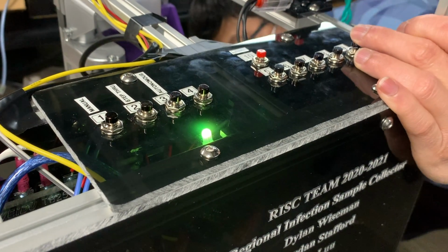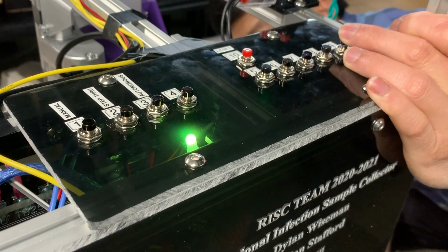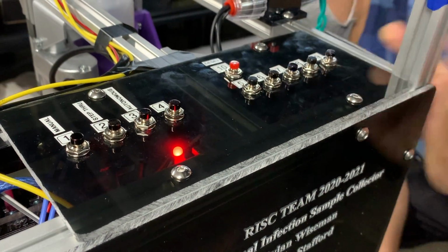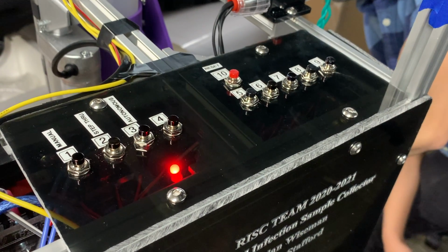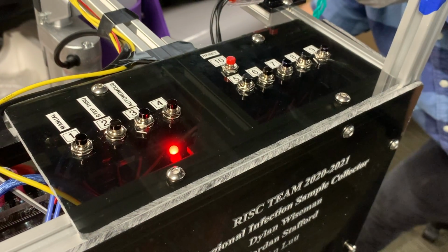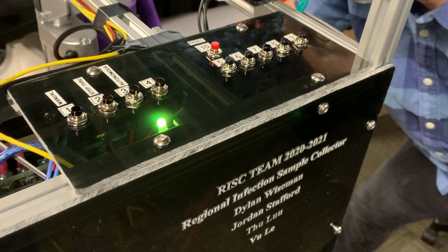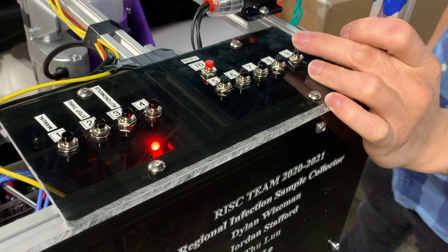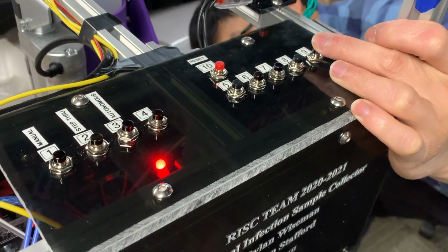An LED light indicates the mode that you are in and if the device is busy. There are 4 options to run the device: autonomous, manual, step-through, and settings mode. In autonomous mode, indicated by a blinking red LED, the device sits in the sewer for a specified length of time and takes 3 samples throughout that time frame, without any need for human interaction.